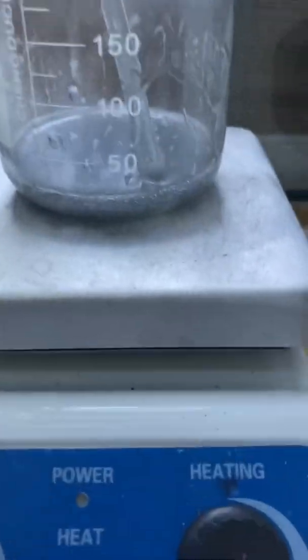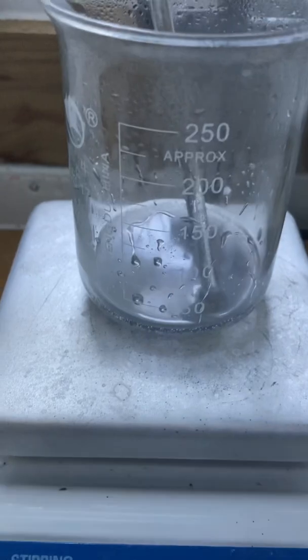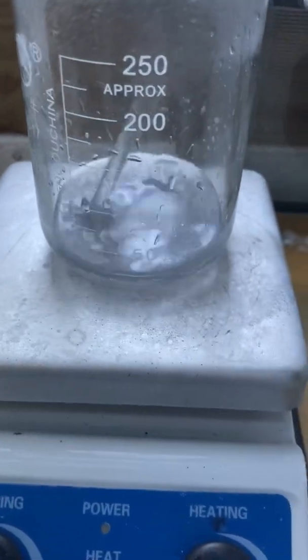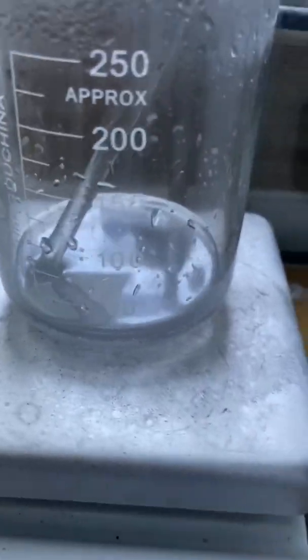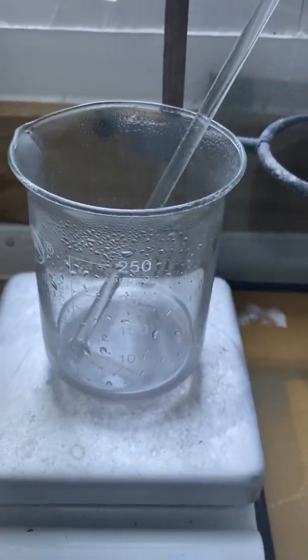As you can see it's all gone. There should be some solid in there. That's the aluminum trichloride and the hydrogen gas has effervesced off.